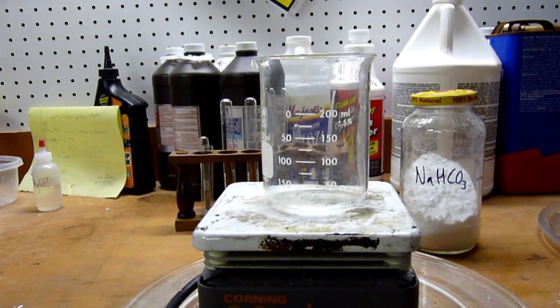Hey, it's Doug again, with another one of my lab videos. Today I'm making part two in a series of copper compound videos. In this part, I saw it fit to update the process of making copper carbonate, which serves as a precursor to many other copper compounds.